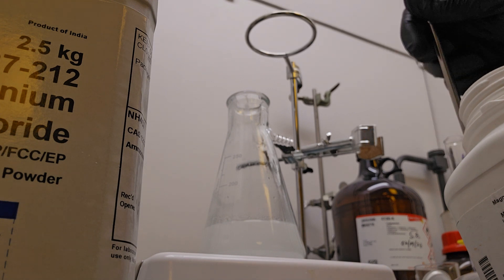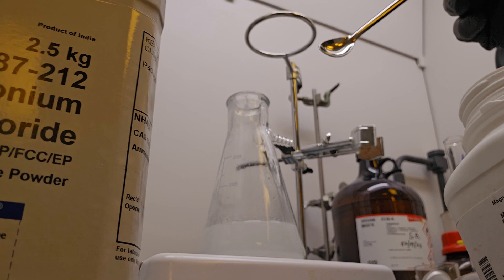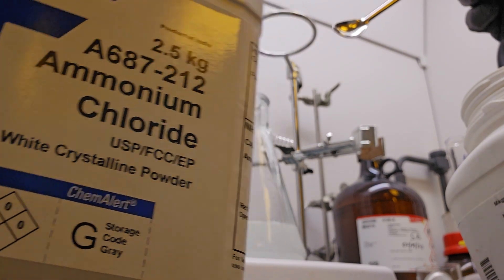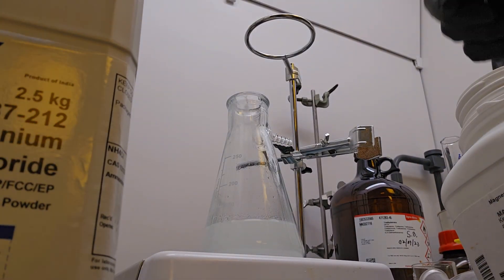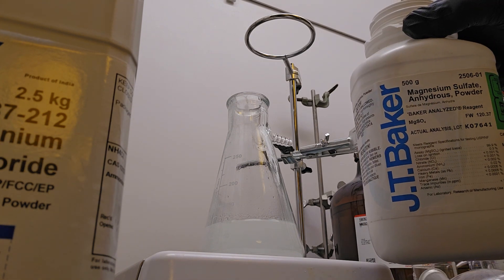We're using, we used ammonium chloride in one step and then today we're going to use magnesium sulfate anhydrous.